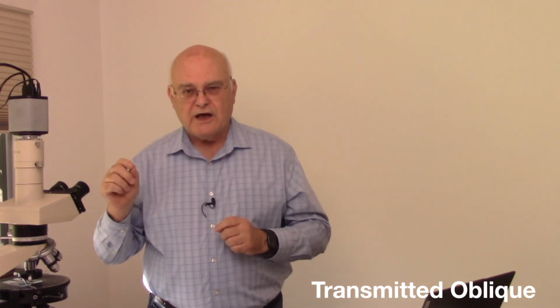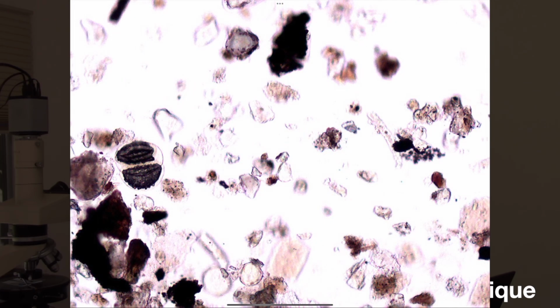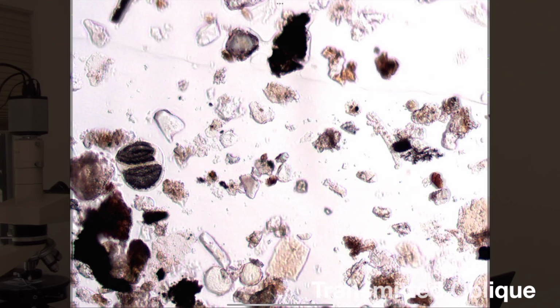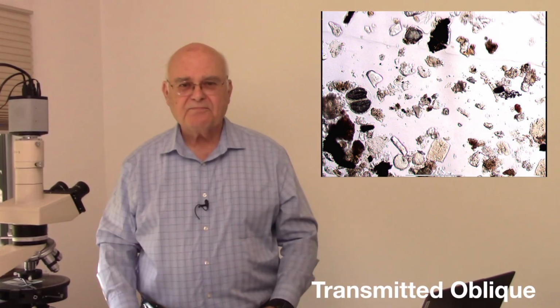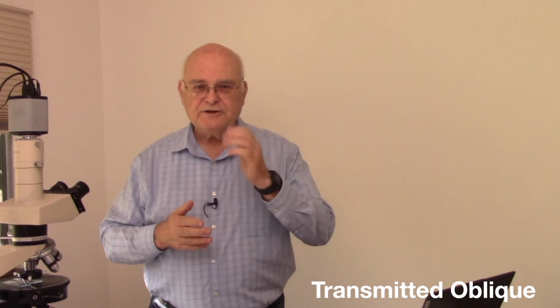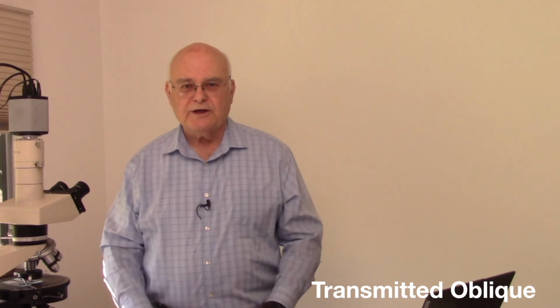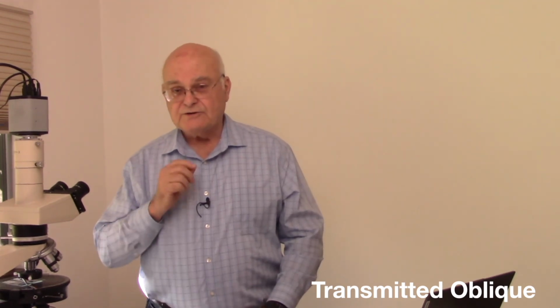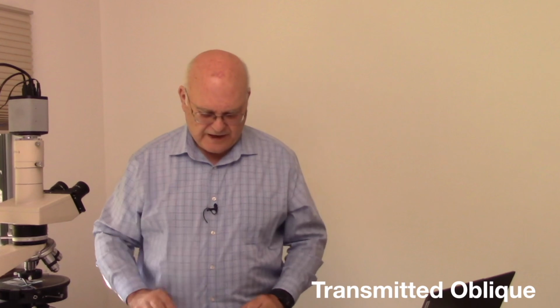This narrow beam of light actually maintains high resolution. It maintains depth of field. It retains contrast. So we get all of the advantages that we lost going between axial beam and cone beam by using oblique illumination. The downside of oblique illumination is it does slightly distort the shape of the particles. And we'll see some of that later.